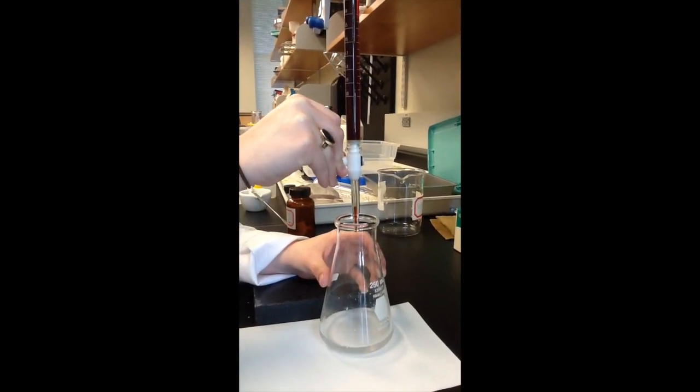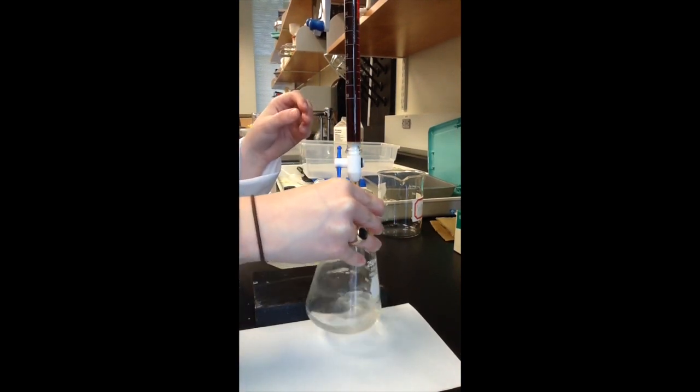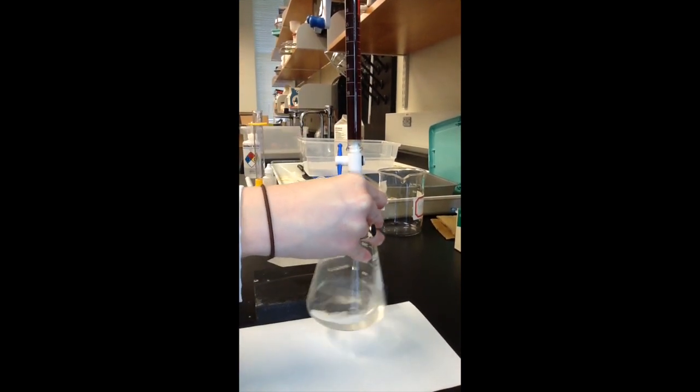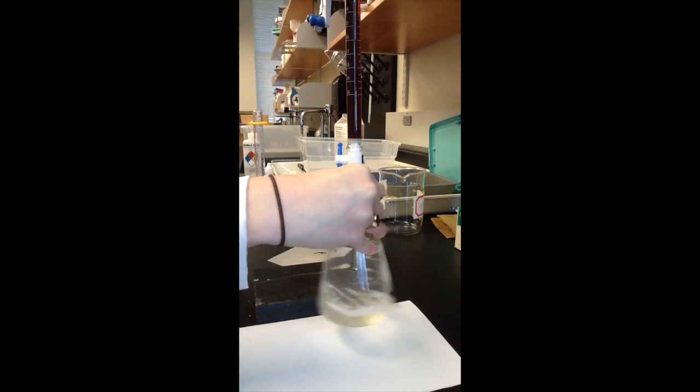Once you have set up your titration, make sure to record your initial volume of the burette to the correct amount of significant digits. Then you may begin.